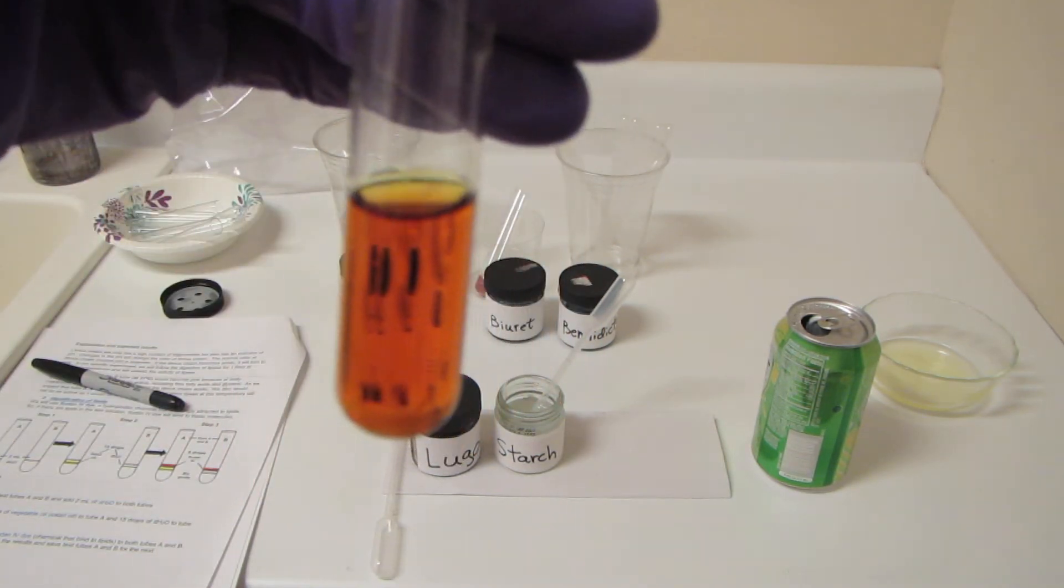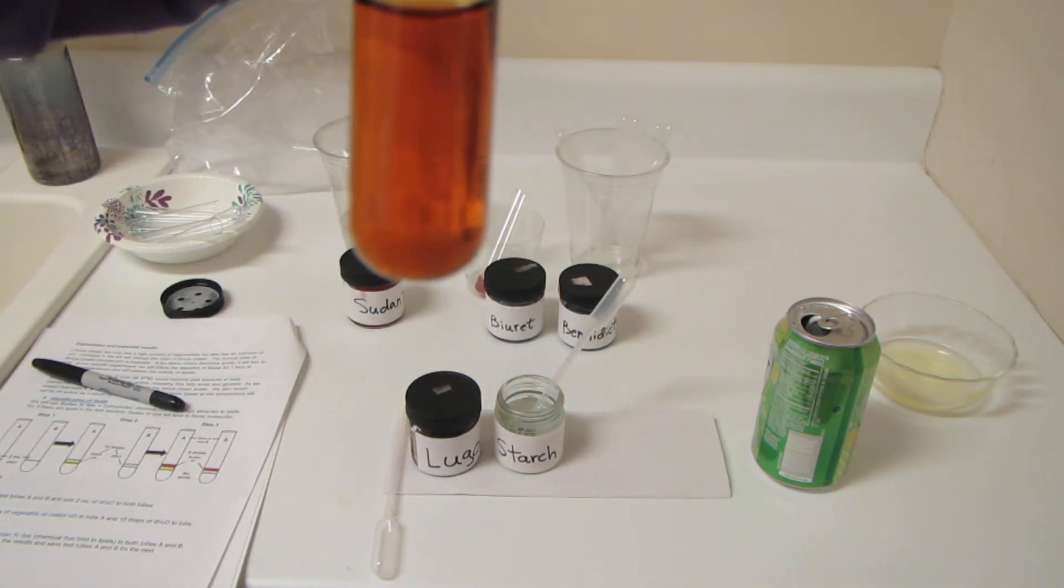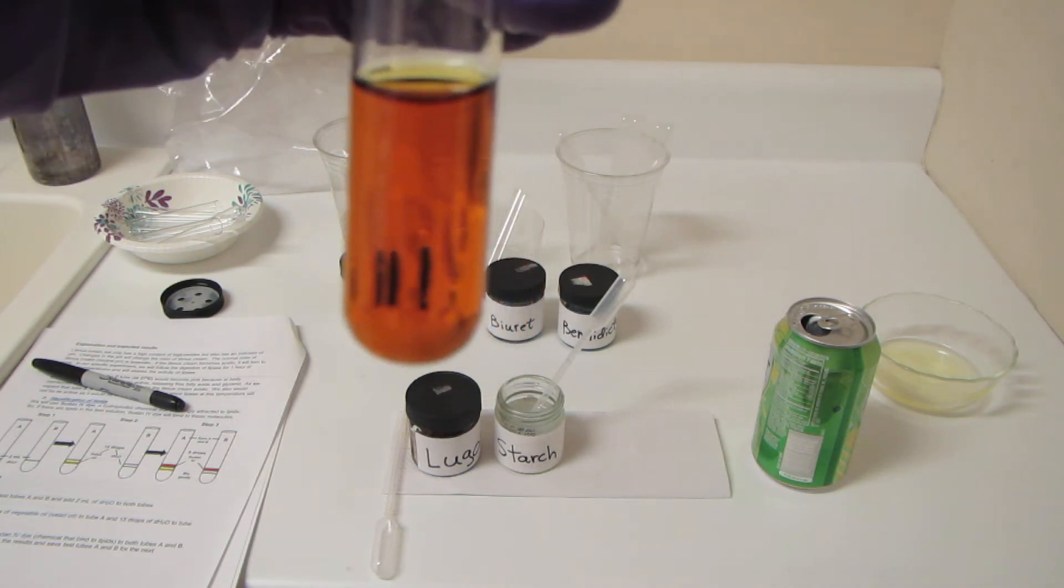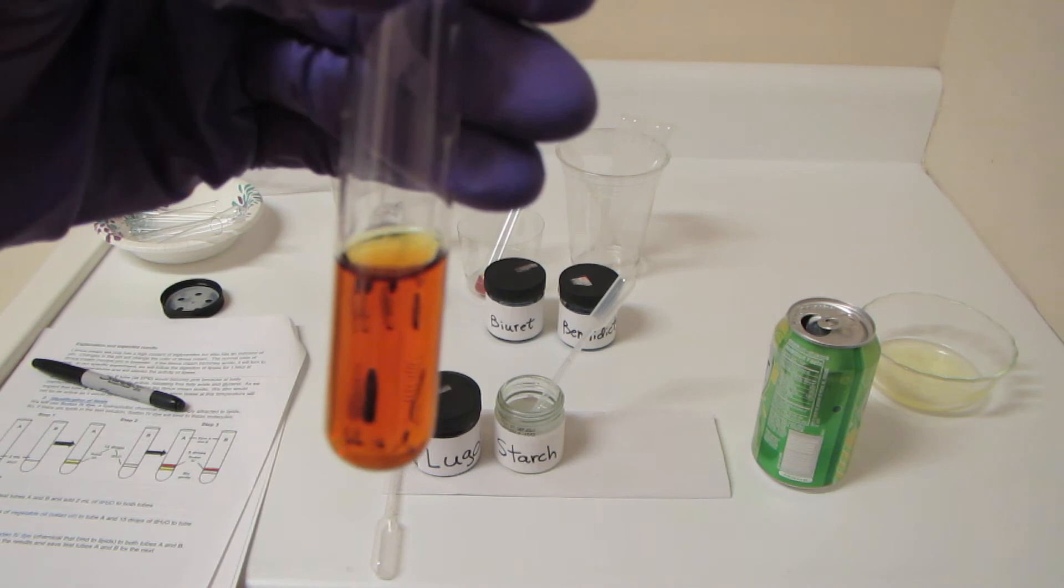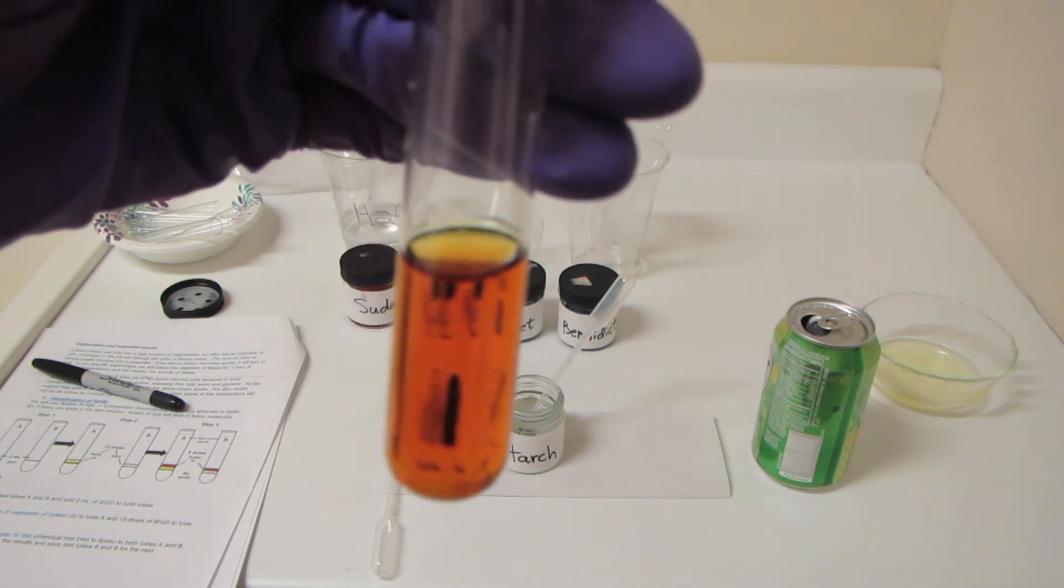No reaction here because Lugols only reacts to starch. It does not react to simple sugars.